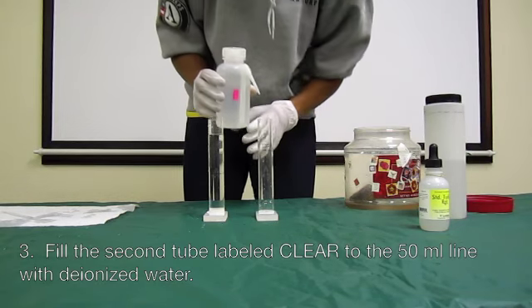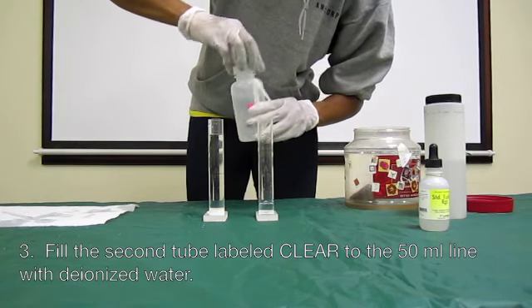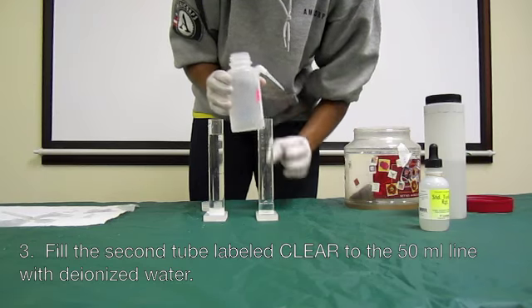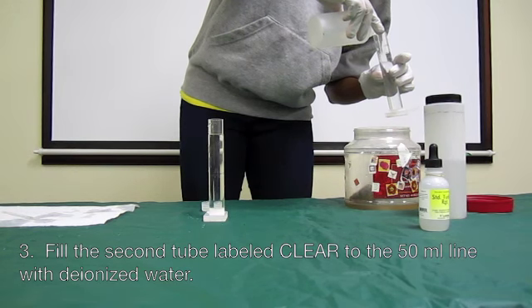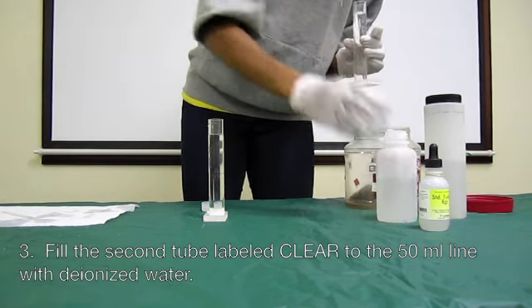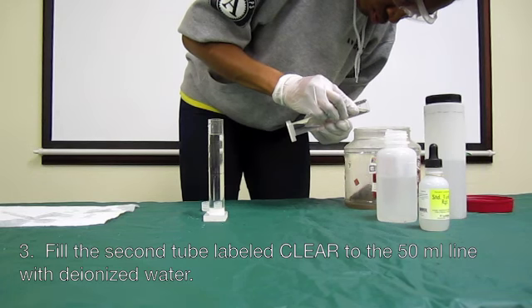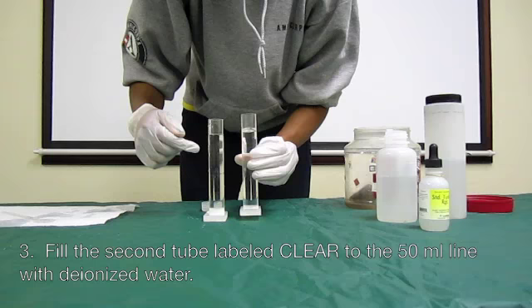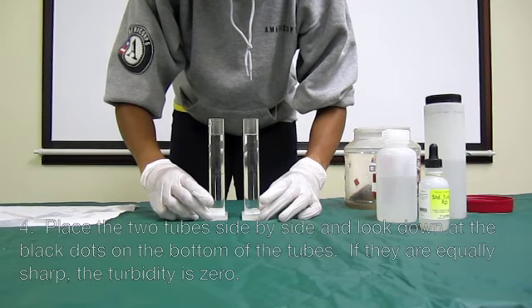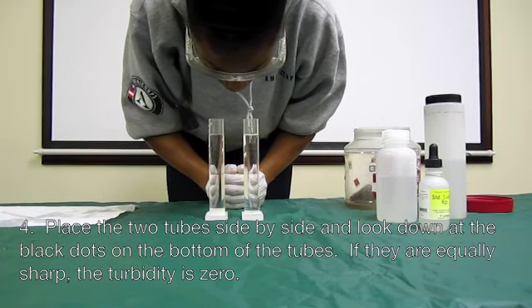Fill the second tube labeled clear to the 50 milliliter line with deionized water. Place the two tubes side by side and look down at the black dots on the bottom of the tubes.